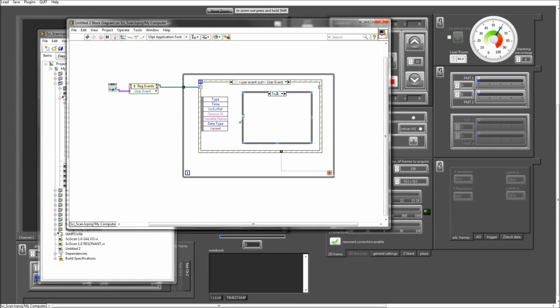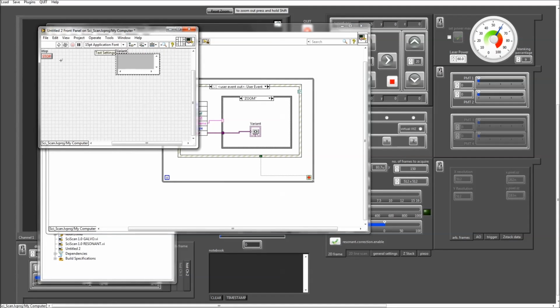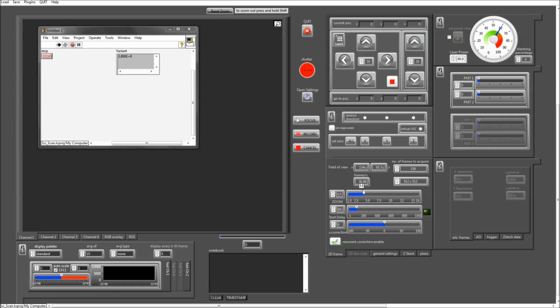For example, say I have a use case where I need to monitor what the zoom factor is. Whenever that zoom factor changes, I want to get an update of what the new zoom factor is. So all I need to do is wire that variable name to my event case here. Whenever the value for that zoom variable changes, I'm going to get automatically alerted here through that user event, and the value will get updated in my new standalone VI. So let me just demonstrate that quickly to you. Obviously I need to run that VI, and now whenever I change that zoom factor here, you can see that change automatically shows up here in my new VI.